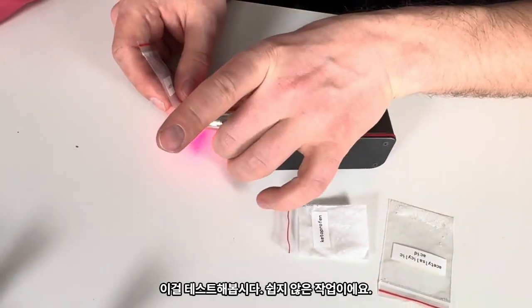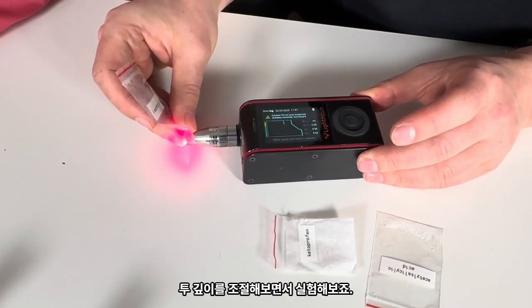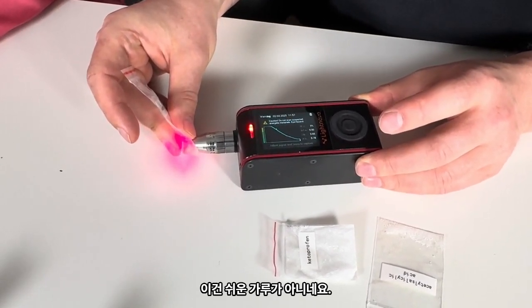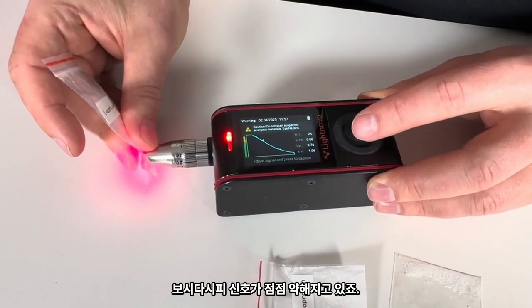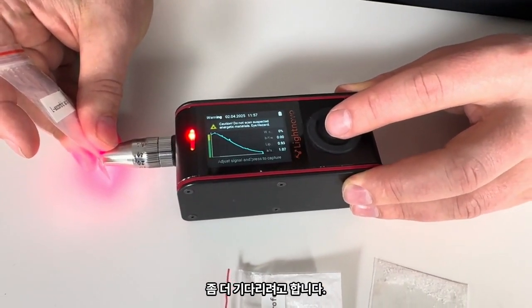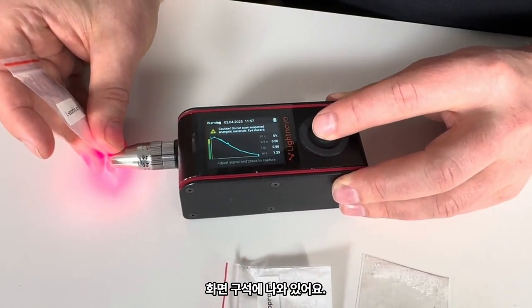This is challenging. Let's try to play with the penetration depth. That's not an easy powder, you're right. I'm waiting for the photobleaching. You see it goes down, down, down, there are some peaks. So I would wait slightly more until I see these peaks. And there is an indication in a corner of the signal intensity.